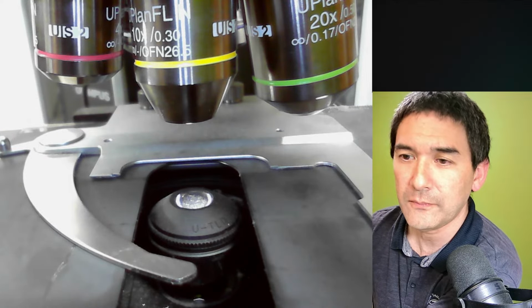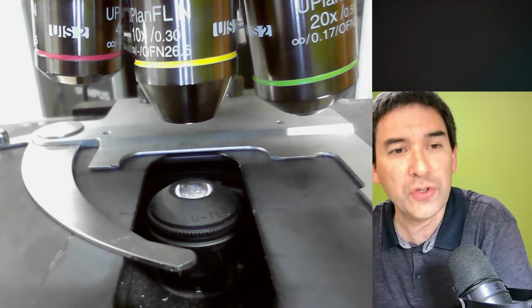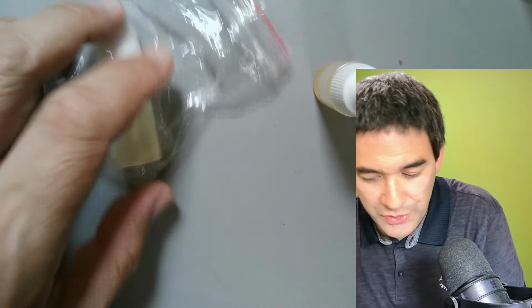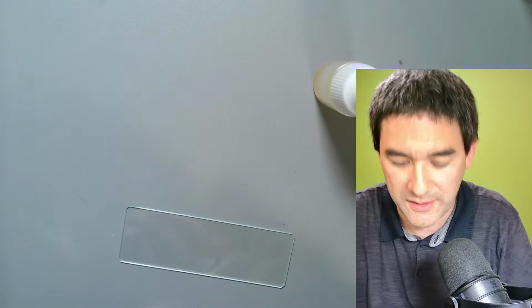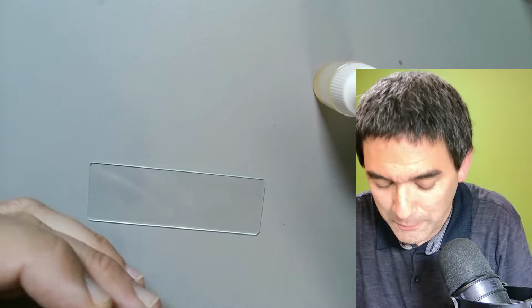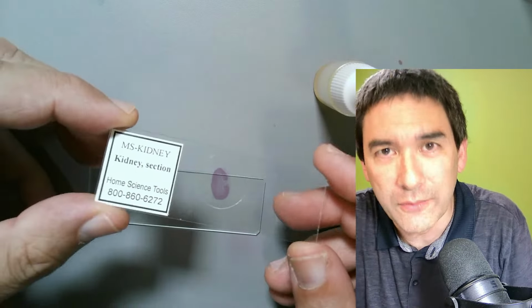So the next thing that I'll be doing now is I'm going to make some simple slides, and later on I'm going to show you some of the heat fixing as well. So when making slides for oil immersion, first of all, just as a warning for those of you who are maybe new to the topic. For the others, you just have to bear with me again.